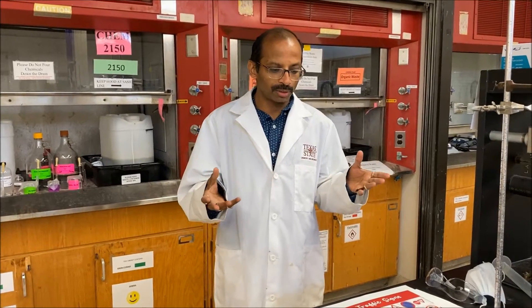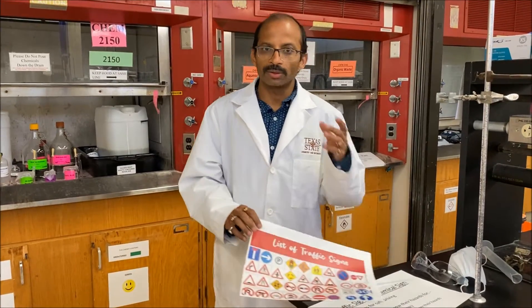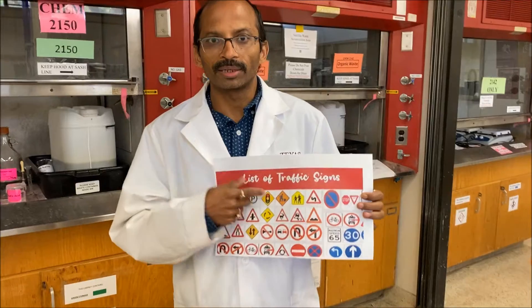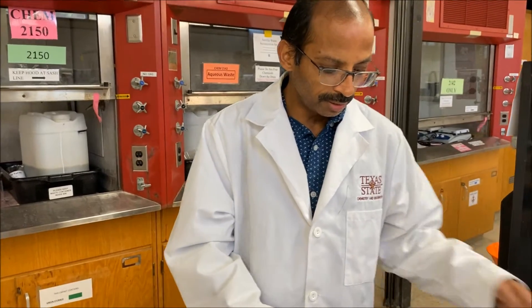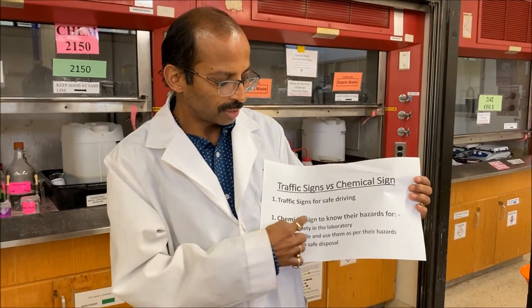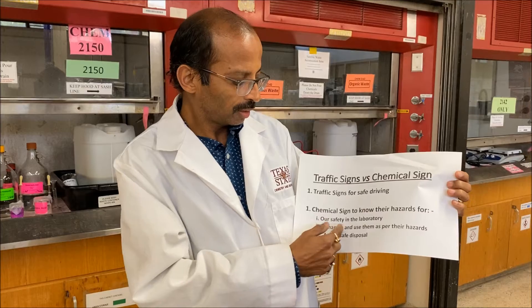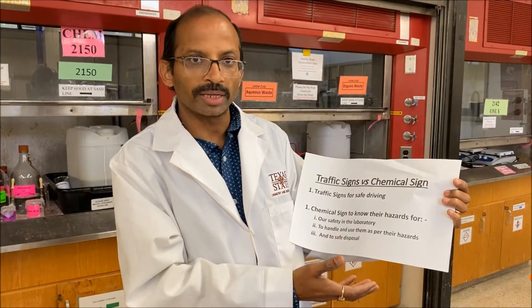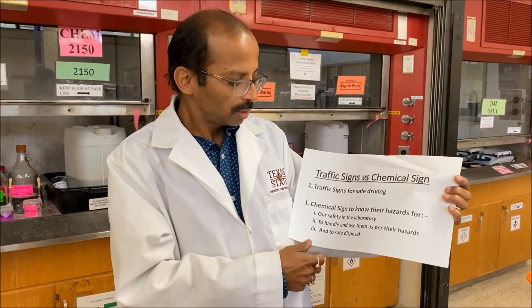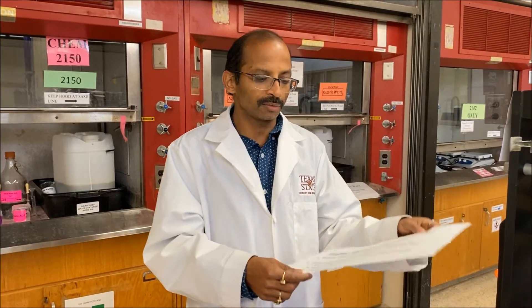In this video we are going to explain the chemicals and their signs for their hazards. That is important because, just as we follow traffic signs for safe driving on the road, we have to follow chemical signs to know their hazards. If we know the hazards of a chemical, it will be very good for our safety — we will know how to handle them, how to store them, and how to safely dispose of them. Let's start to understand the different signs of chemicals.